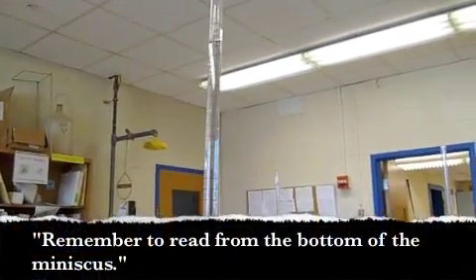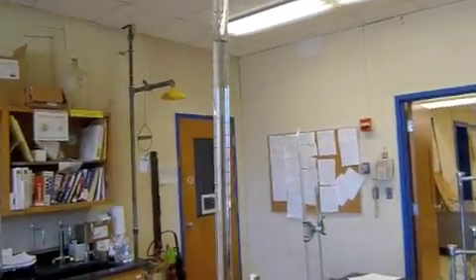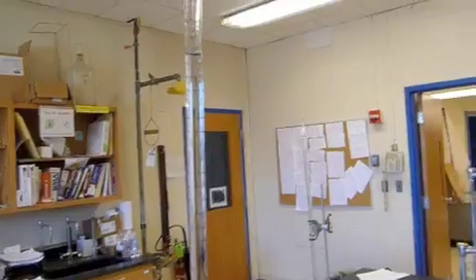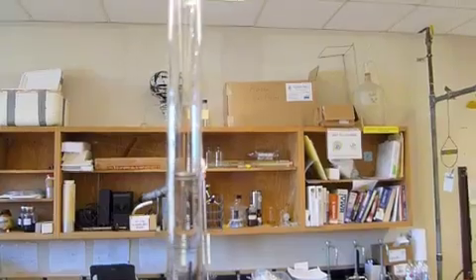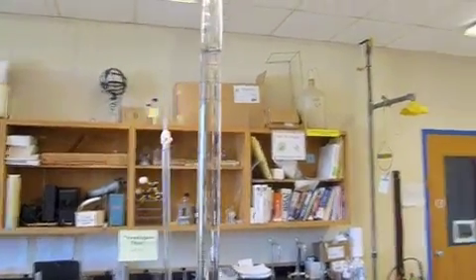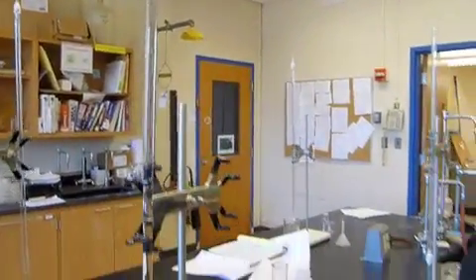Remember, you read from the bottom of the meniscus. I'm reading 0.5, so that will be what I record as my initial burette reading.